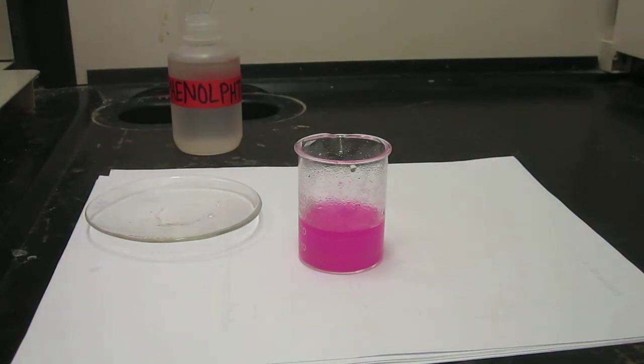So if you look at the color change of phenolphthalein, it went over the basic portion. So you can see that it's pink. Are there any questions about that? No. Okay, cool.